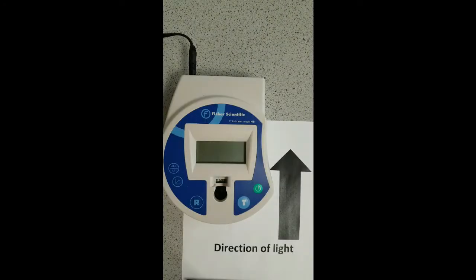In this video, we're going to have a quick look at how to use a colorimeter. We can use colorimeters to measure the level of absorbance or percentage transmittance of a particular wavelength of light through a sample, or even monitor simple kinetics by looking at changes in absorbance over time to determine reaction rates.